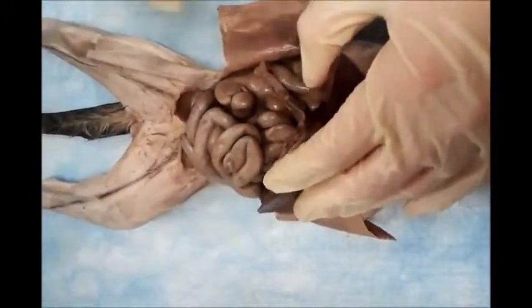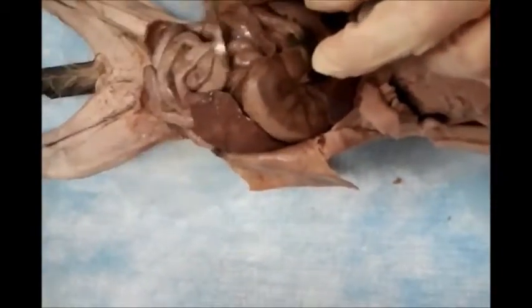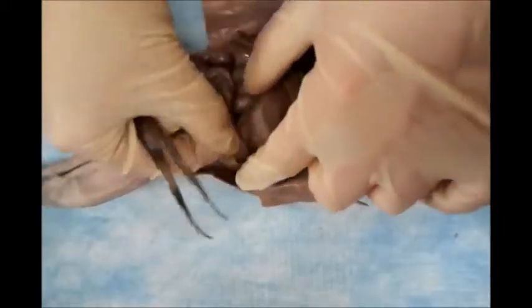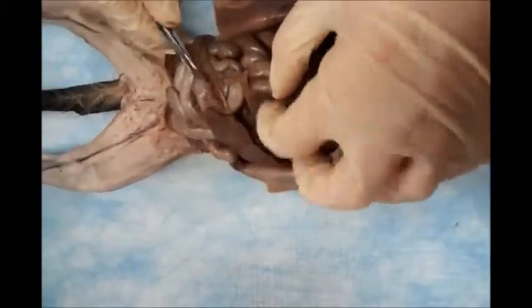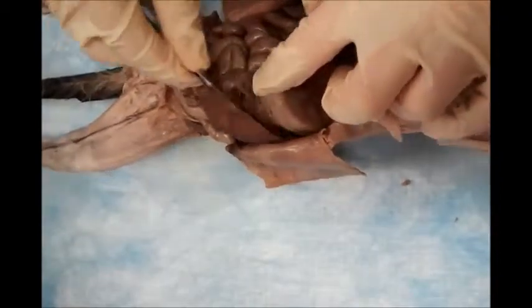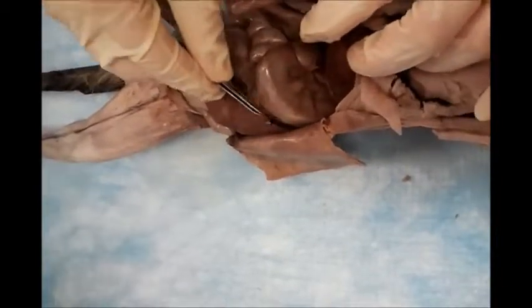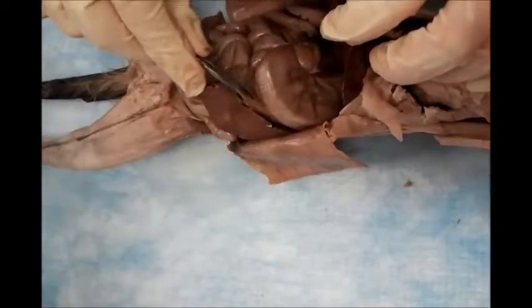Now we'd like to follow up to the stomach. The key for the stomach is the greater omentum. Where is the greater omentum? Yes, here you go. It's a sheet of fatty tissue like that, and it should be attached to the greater curve of the stomach. The stomach has a greater curve and a lesser curve, a small one. So attached to the greater curve is the greater omentum, which is this one.